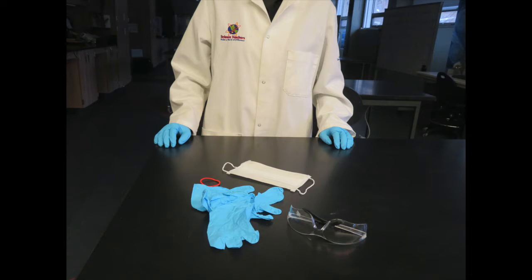As well note the PPE: gloves, safety glasses, hair tie, mask and a lab coat.